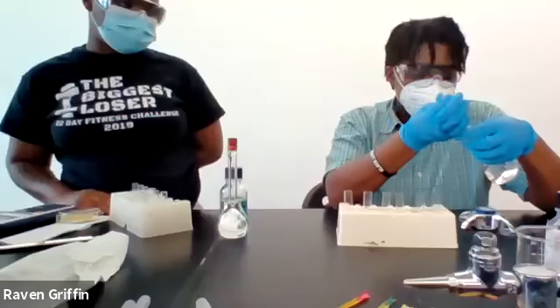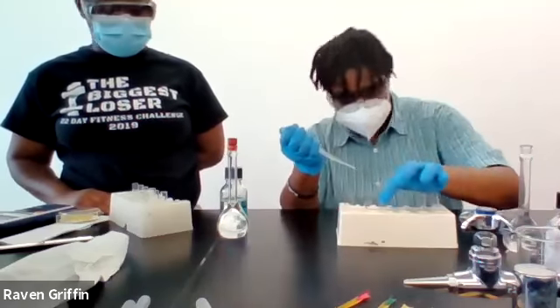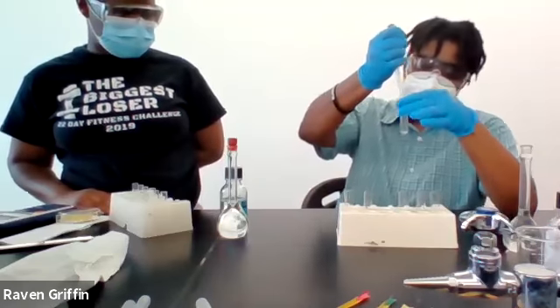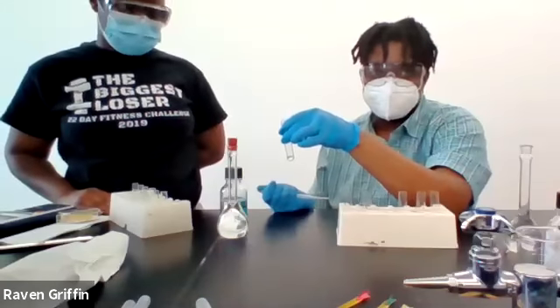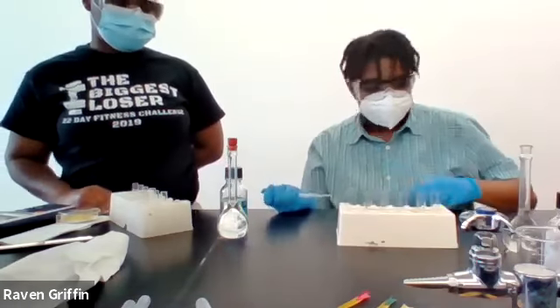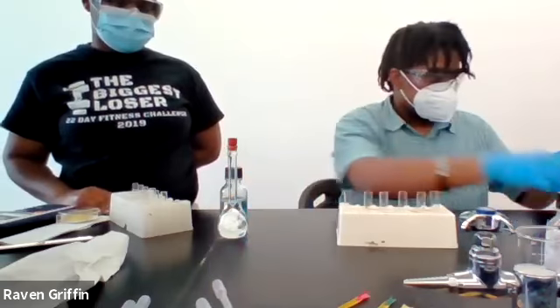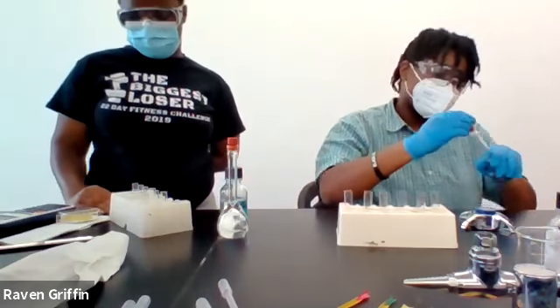Let's try that same acid, H3PO4, with copper. What's the concentration of the acid again? 3 molar. They're all going to be 3 molar in this one. Yeah, so nothing's happening with that copper. All right, we're done with phosphoric.